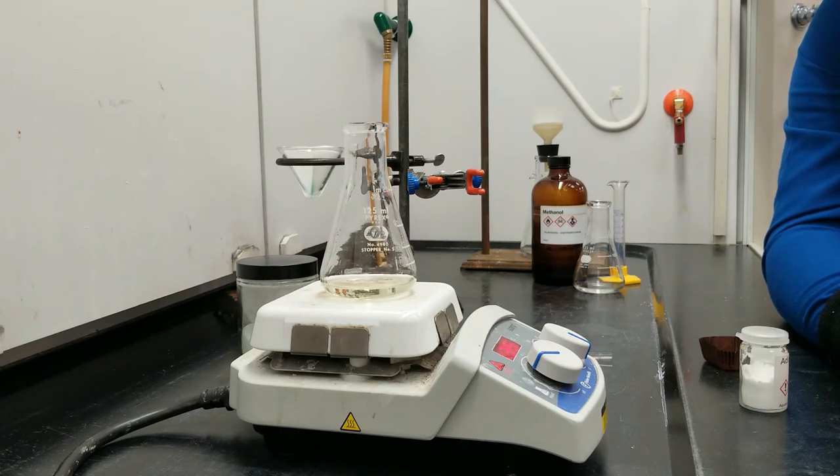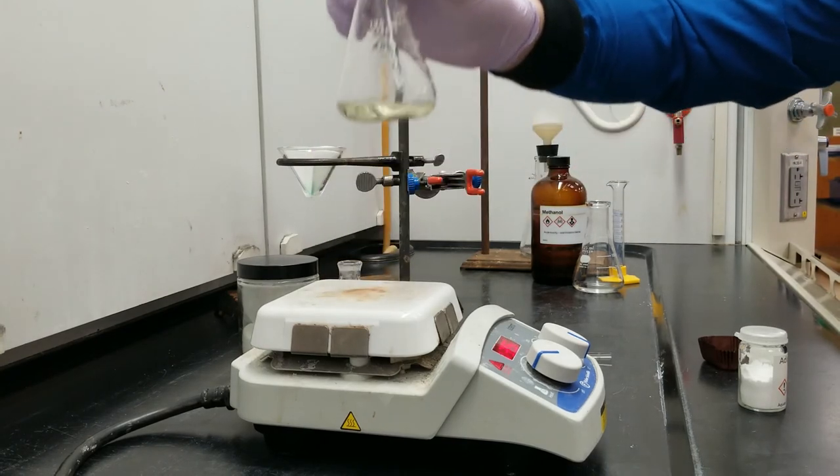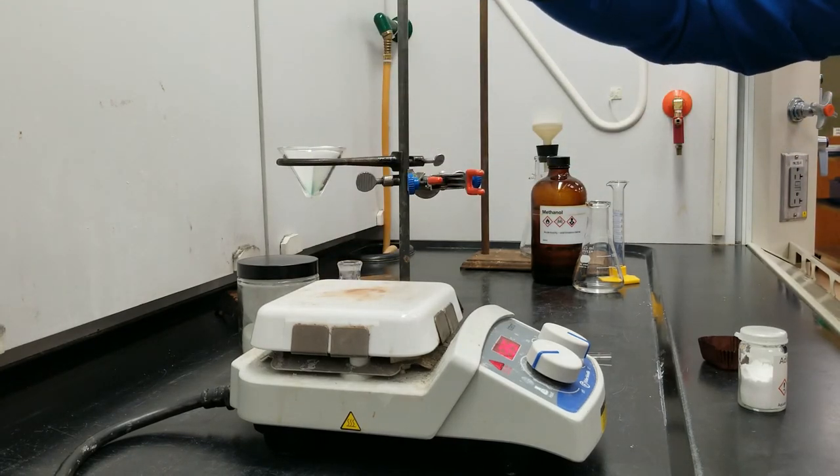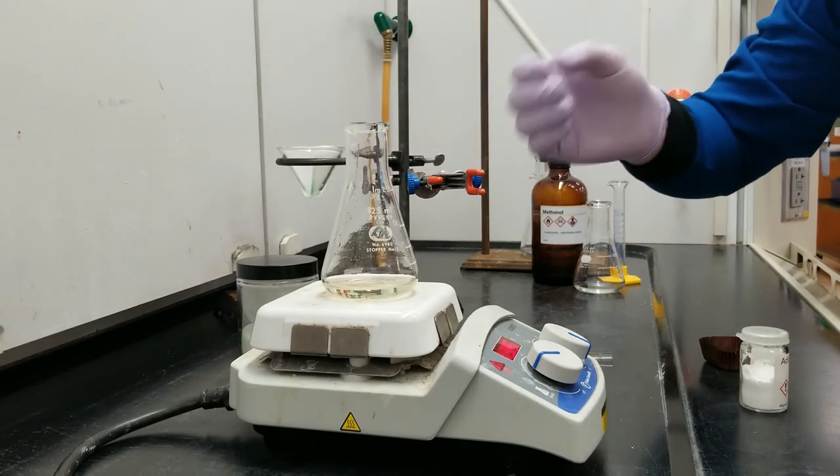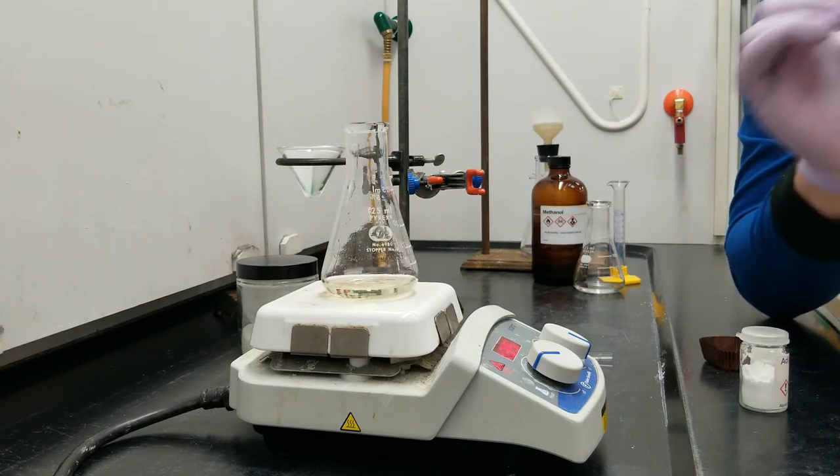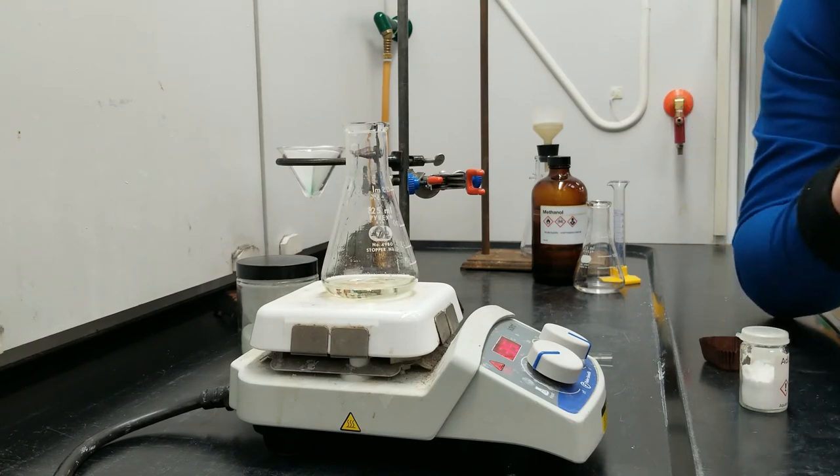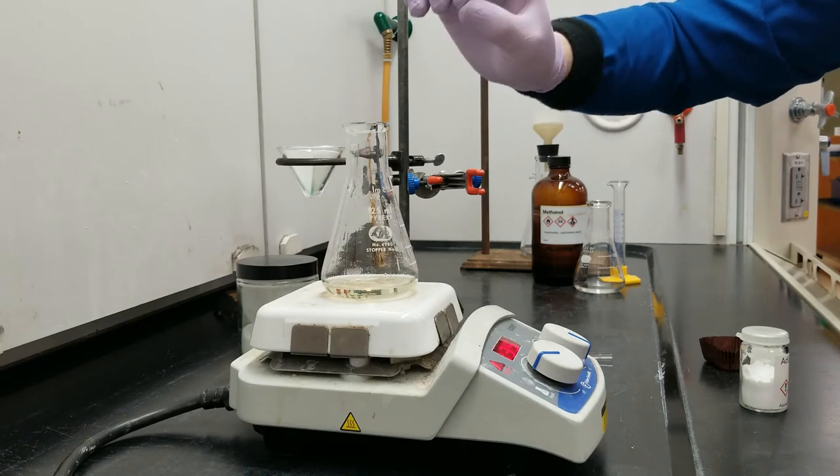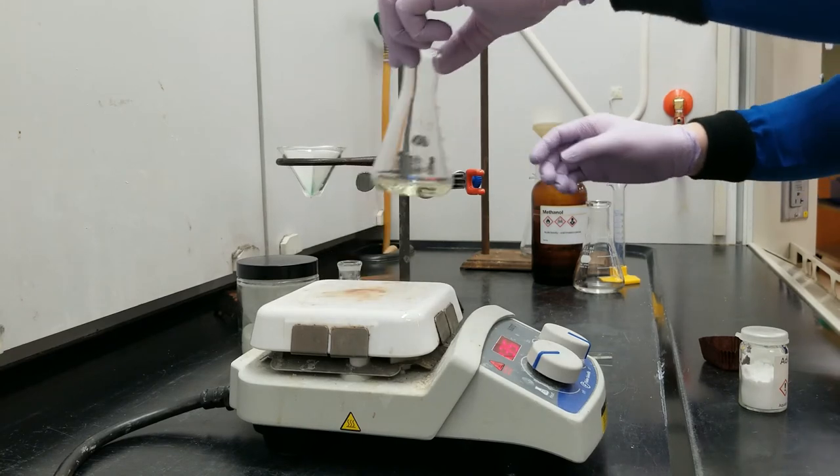Okay, so that's how long it took for the methanol to come out to a reflux. I'm seeing those lines of liquid falling down the sides of the glass. I'm looking down here at my mixture, and it's a little bit discolored, so there's still some impurities we need to get out. But it's entirely clear. And that's really important, because I need this mixture to start perfectly dissolved if this recrystallization is going to work properly and produce a pure product. So I'm at reflux as hot as I can get. Everything's perfectly dissolved. And now I'm going to do this.